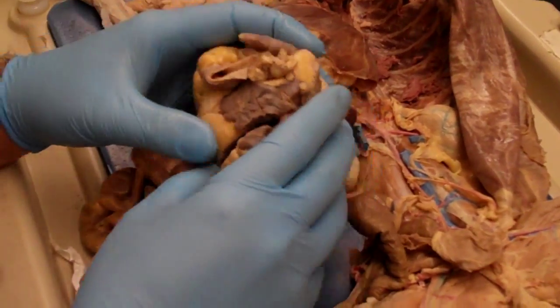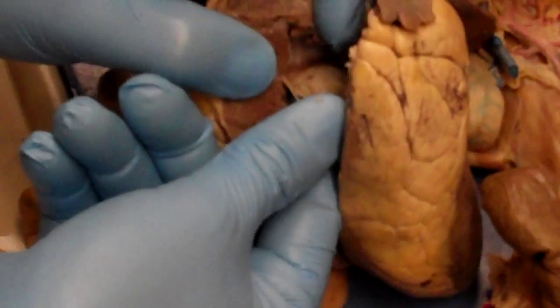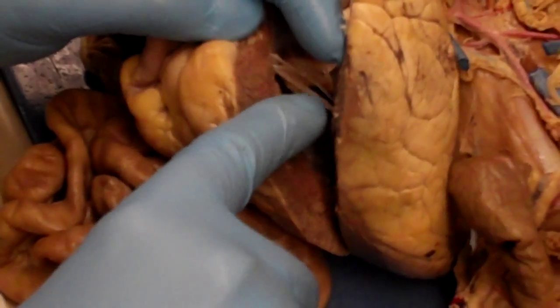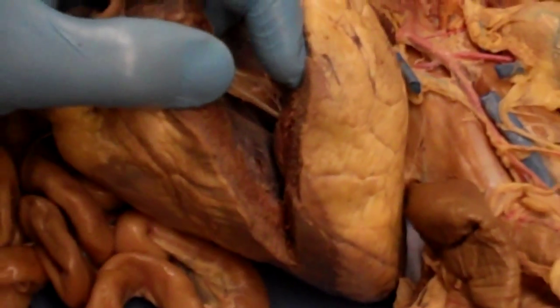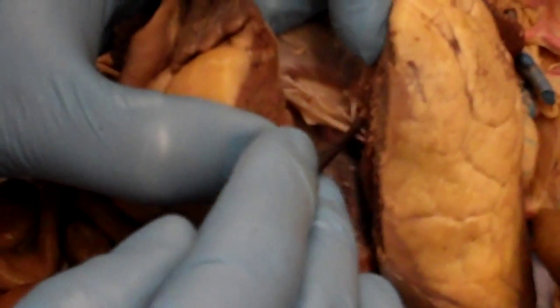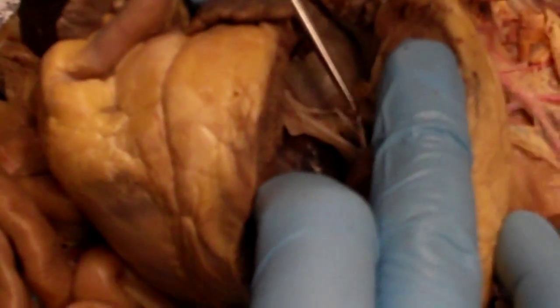And then the chordae tendineae? Chordae tendineae, when we were talking about the valve, and there's some good examples right here, the valve itself is the sort of flap, but you can see these relatively rigid little strings, little cords that are connecting the valves to these little bundles of muscles known as papillary muscles. So the little strings are the chordae tendineae. So these are all chordae tendineae right there. These little threads. You mentioned papillary muscles. Yeah, so they're sometimes harder to see, but the chordae tendineae should originate off of these little finger-like projections of muscle, which are going to be papillary muscles.